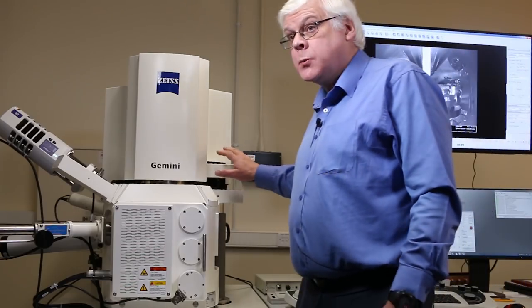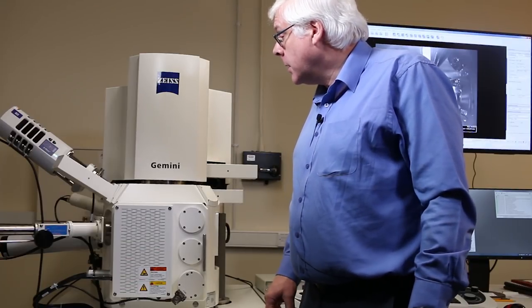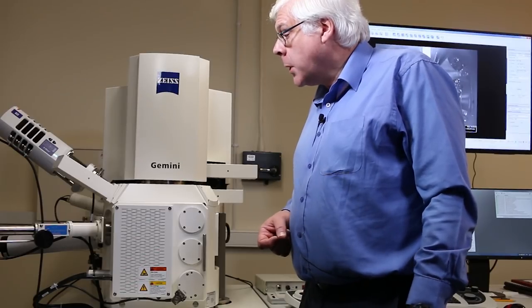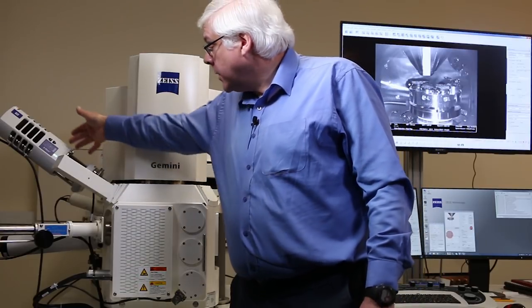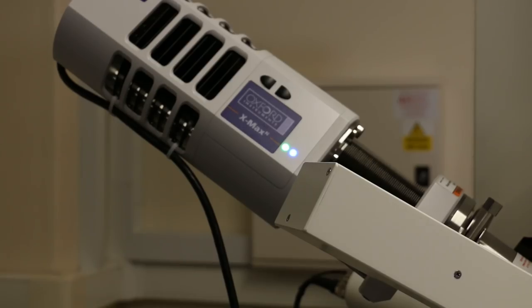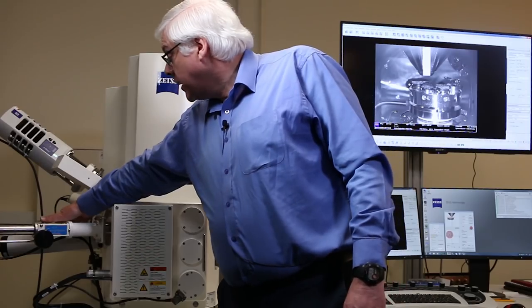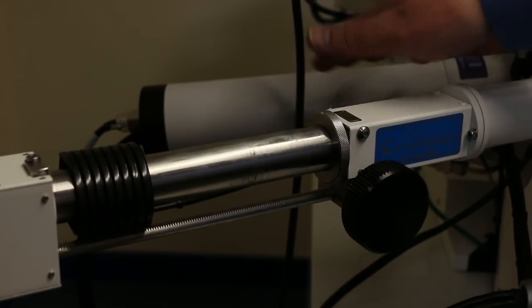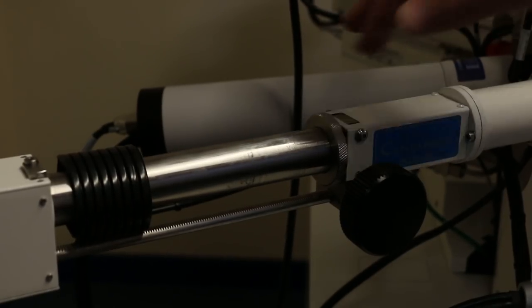We have different detectors bolted on to the outside of the instrument, and they allow us to produce images of the sample. As well as imaging, we can also do analysis with this SEM. We have an x-ray detector which gives us information about sample composition, and we also have an electron backscatter diffraction detector which gives us information about the crystal structure of samples.